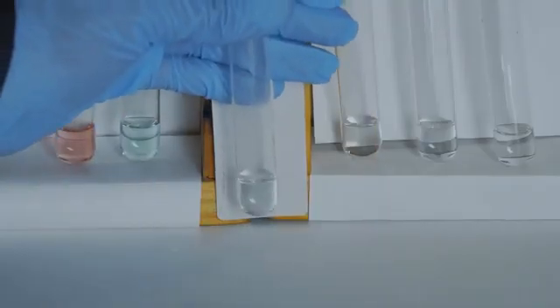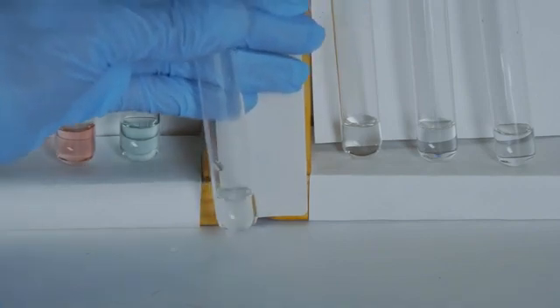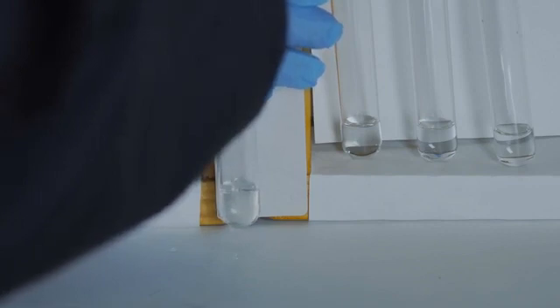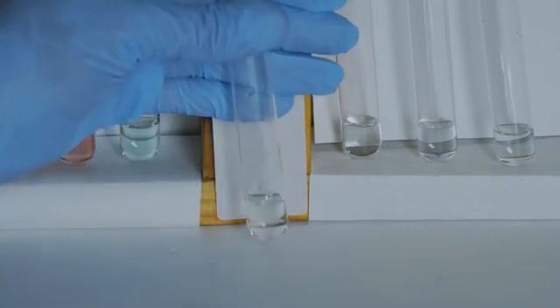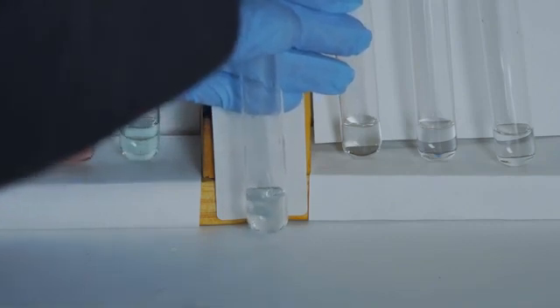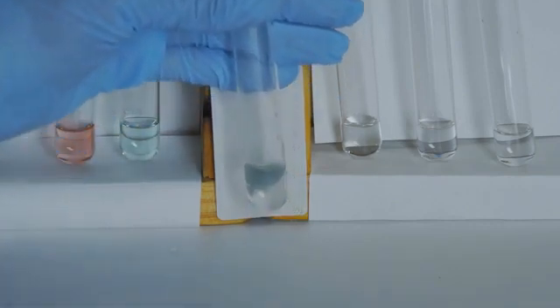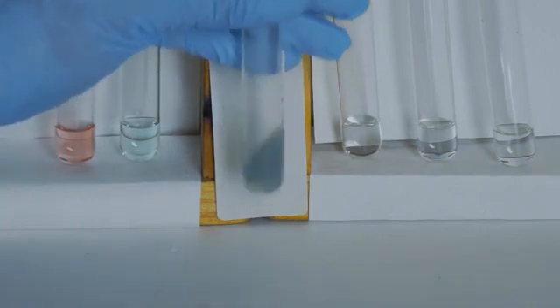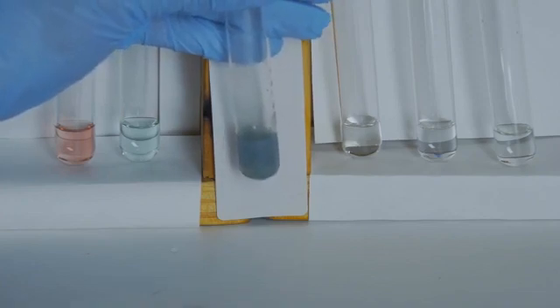To our unknown solution D, which is clear in color, we shall add in our 3 drops of ammonium chloride and 5 drops of ammonium hydroxide. This forms a blue-green precipitate. Because of this, we suspect the iron 2+ cation.